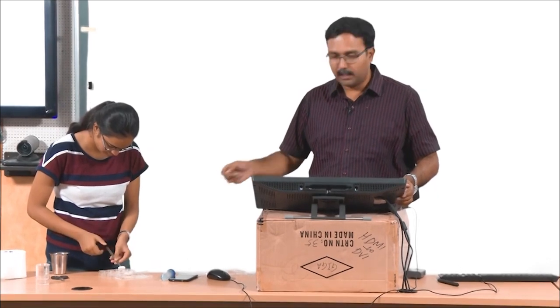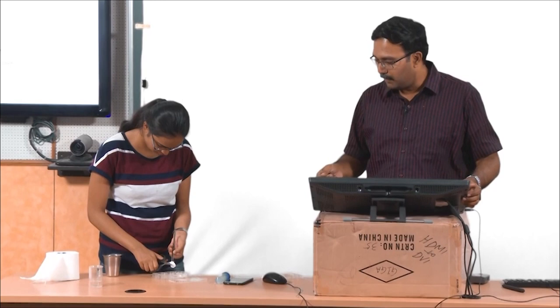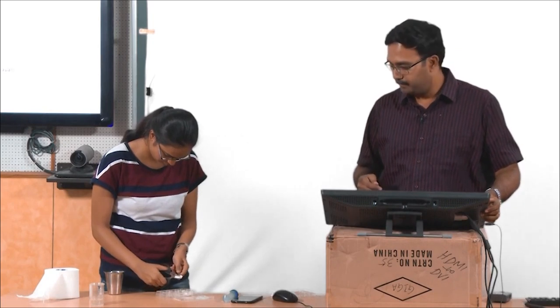After we put up a small piece, you can actually feel the texture of the dry ones, and after swelling you will be able to see how it feels. That is PVA — it is quite strong actually.